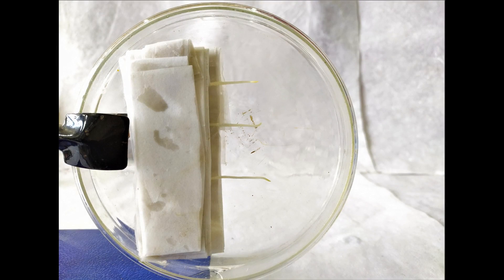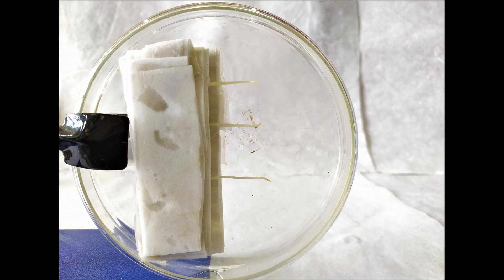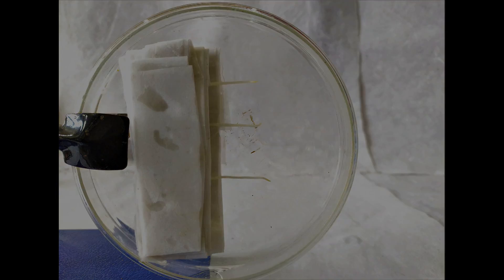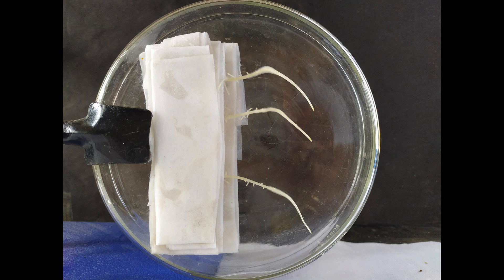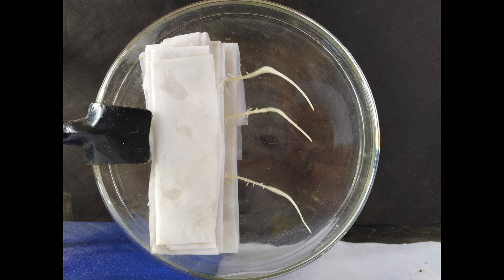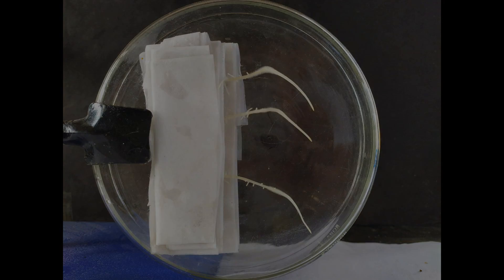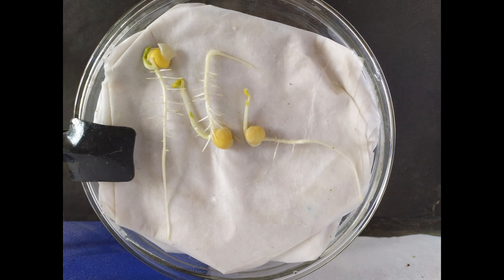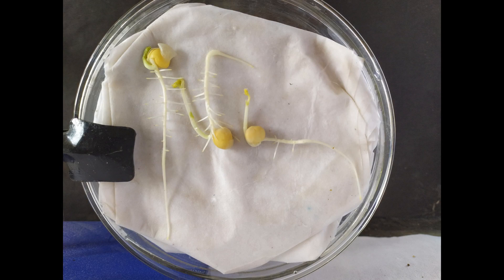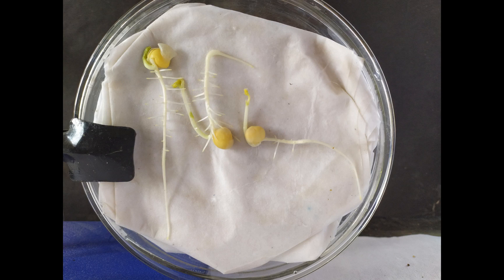Place the petri plate in the dark for a few days. After a few days, observe the roots in the petri dish. You'll notice that the roots have begun to bend downwards along the force of gravity, suggesting that the roots are positively geotropic. You may also find that the young shoots, if they have already appeared, begin to bend away in an opposite direction to the force of gravity, suggesting that the shoots are negatively geotropic.